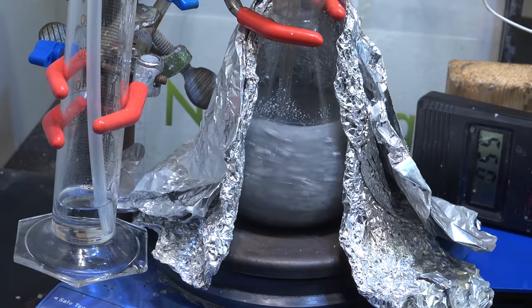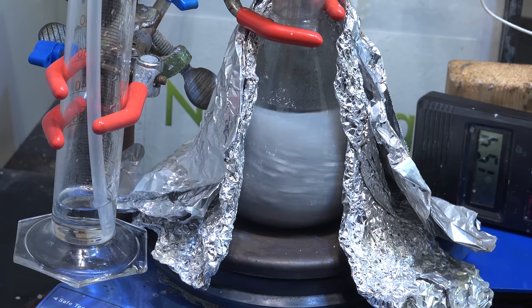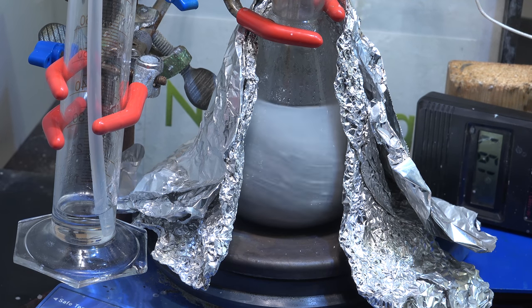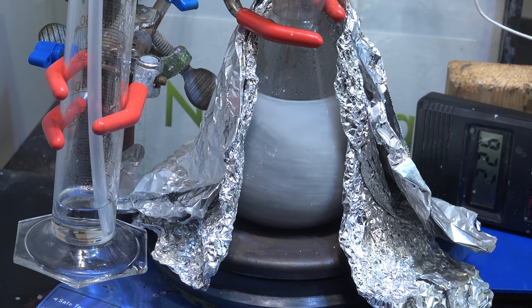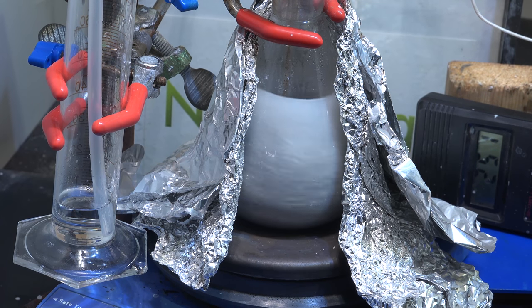I then proceeded to add magnesium, mineral oil, and a borneol catalyst and heated up the reaction to try and make lithium. Unfortunately, there was no hydrogen formation at the usual operating temperature of 200 Celsius. So we increased the temperature further to 250 Celsius, which is the maximum I can reach on my hot plate. Normally I wouldn't do this since the flask usually gets destroyed by sodium hydroxide at that temperature, but lithium hydroxide seems to be much less corrosive. Anyway, it worked. Hydrogen started to bubble out.